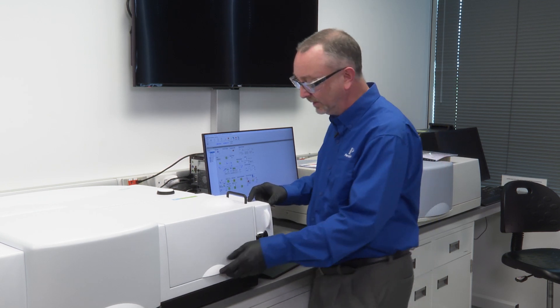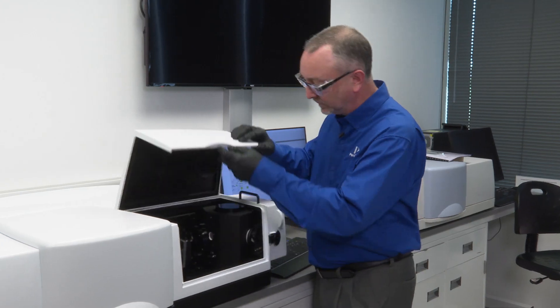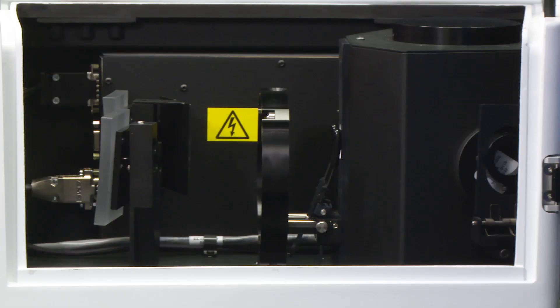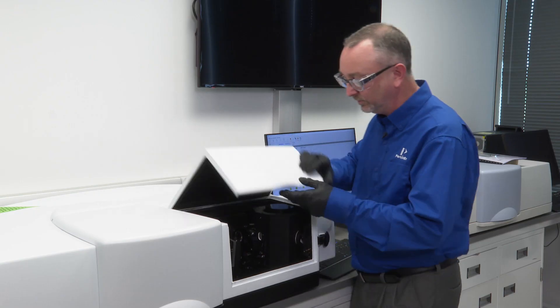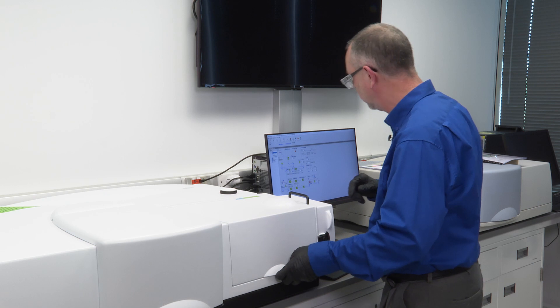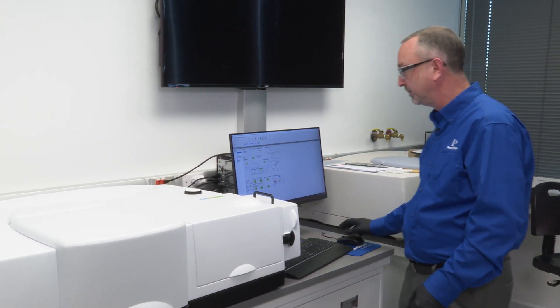Place that in here. As you can see, nothing is changed, nothing is removed. Let's look at the software.